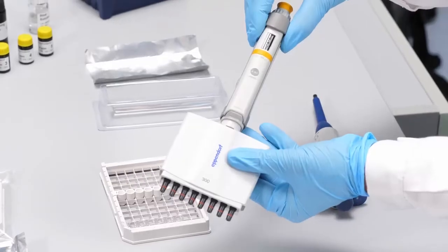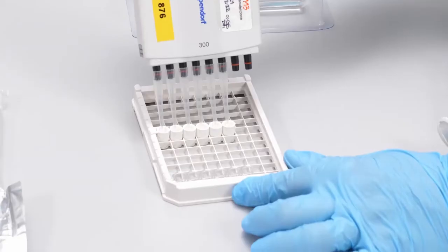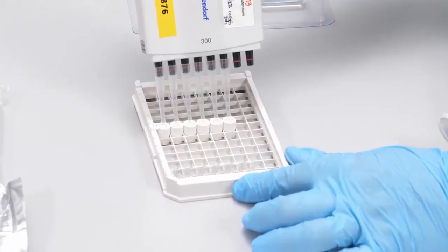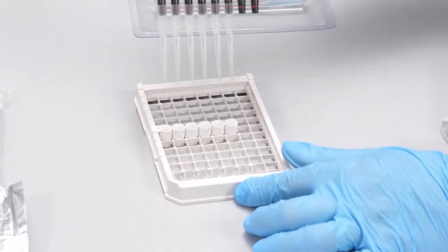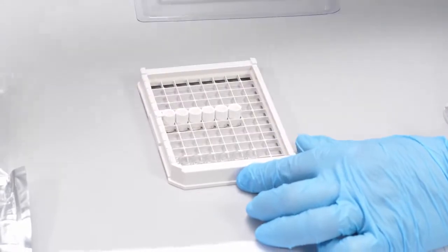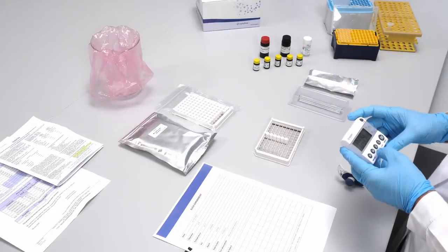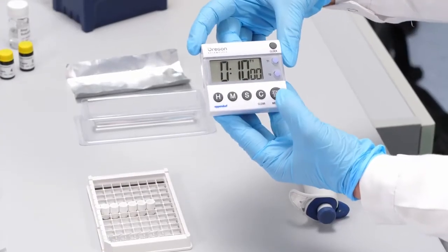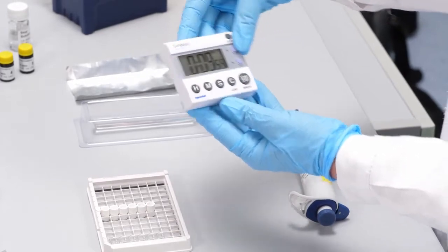Mix and transfer 100 microliters of mixture into the correspondent reaction wells. Incubate the assay for 10 minutes at room temperature. Do not shake the plate during the incubation.